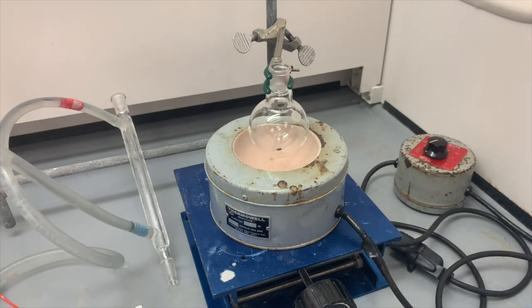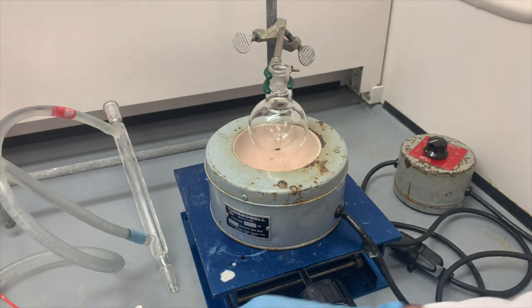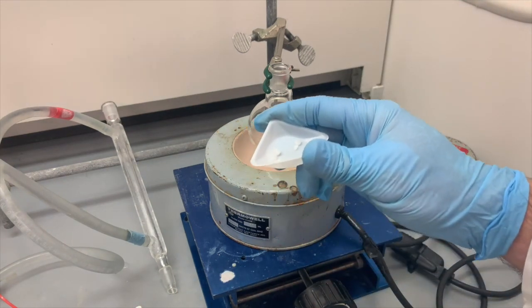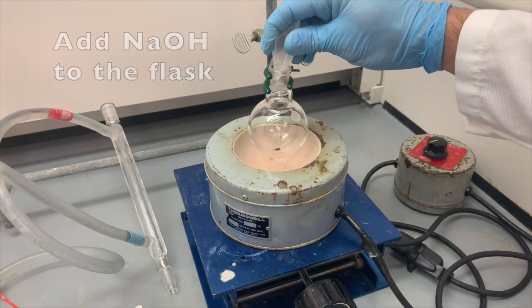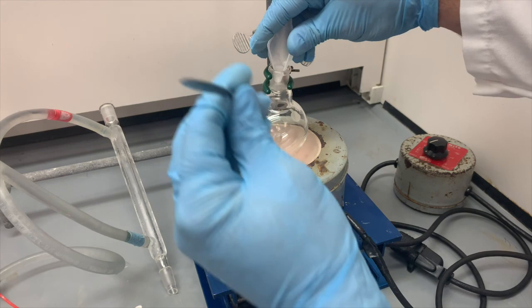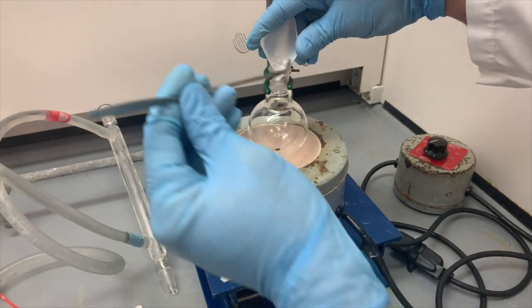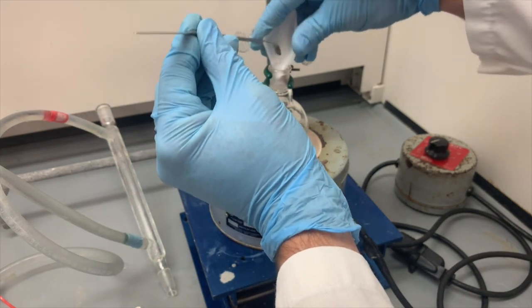Okay, let's set up the first part of the reaction. Again, the boiling chips are already in there. To this flask, I'm going to first add the sodium hydroxide pellets. I'm not going to use my funnel for this because the funnel I have is a little too small. And look, because it's so hygroscopic, it actually sticks to our weigh boat.